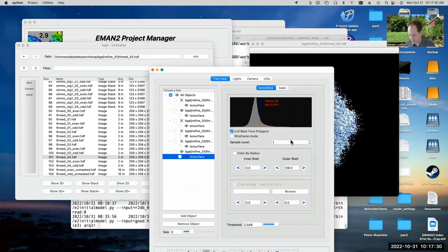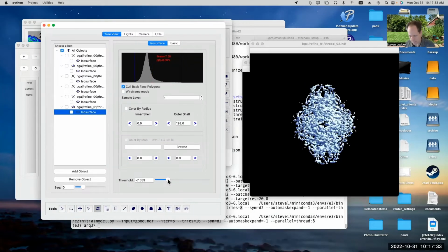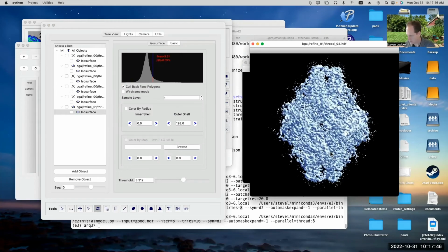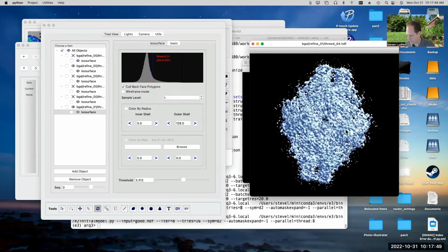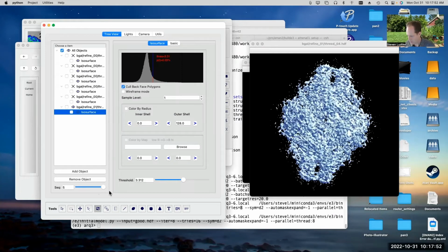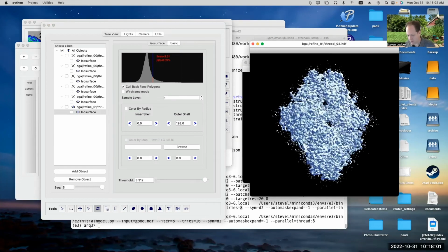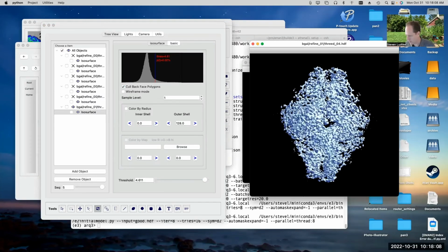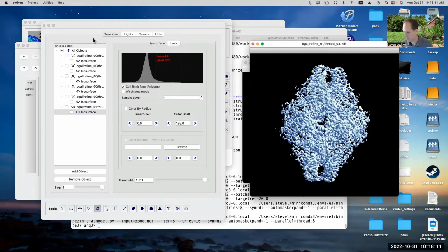So let's take a look at the final 3D map that we got out from that second round. And again, we'll have to adjust the isosurface threshold on this final map. Around 3, 4, something like that. As we rotate it around, you can see it's a little noisy. It would have been nice if we'd filtered some of that out. But we can compare that to that. So you can see it has more features inside it. Anyway, it refined to a pretty nice structure, and we could compute an FSC between that structure and the known structure for this data set if we wanted to, and I'm sure we would get a very nice number, although I didn't actually do that at this point.